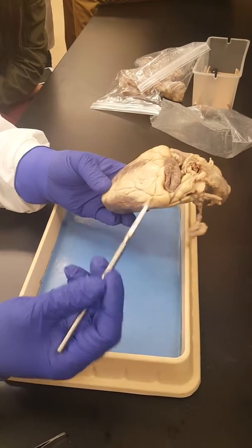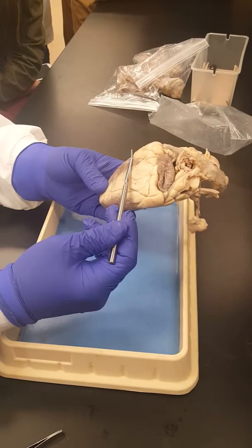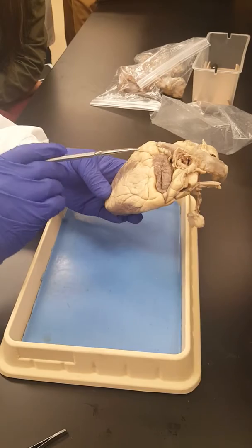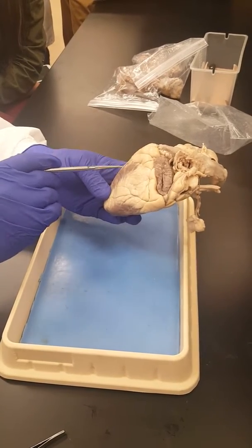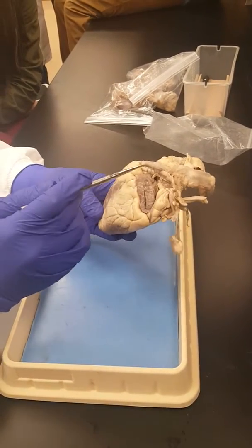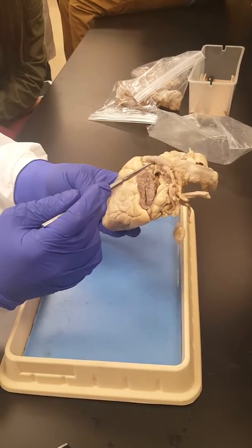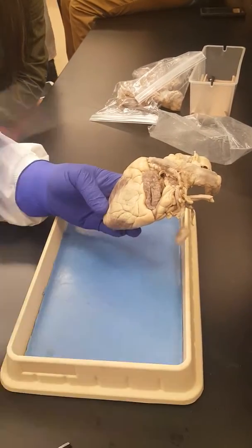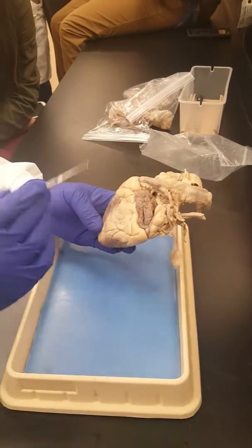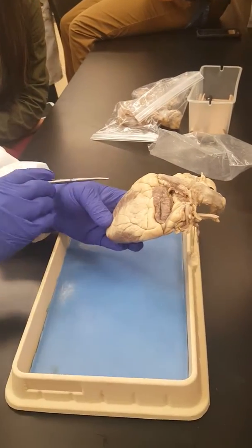Okay, and the second thing that confirms this is the anterior side is this right there. Coming from the smaller part of the division by the interventricular sulcus, you'll find a major blood vessel coming out of that smaller side. Okay, and that is the pulmonary trunk. So if you don't see this right in front, forget it, it's not the right line. So pulmonary trunk, interventricular groove sloping from top right to bottom left.